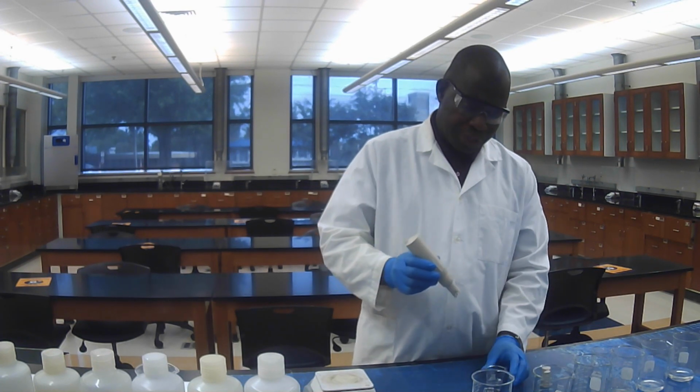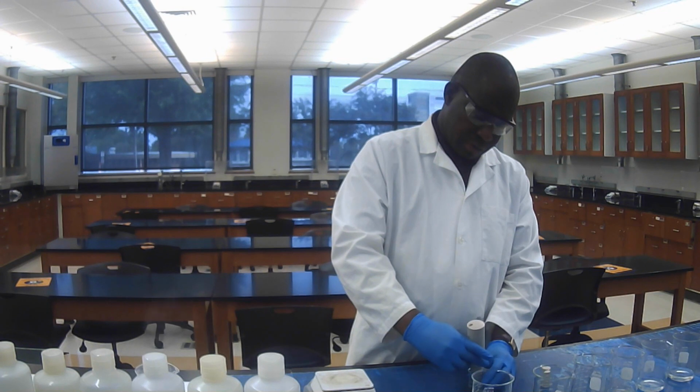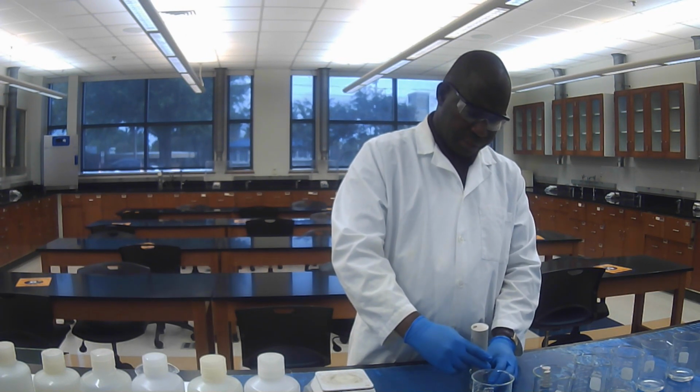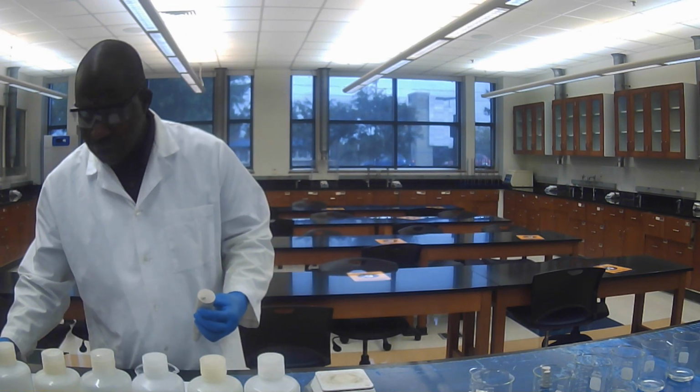I'm going to take the pH of the unboiled water and write the result in my lab book.